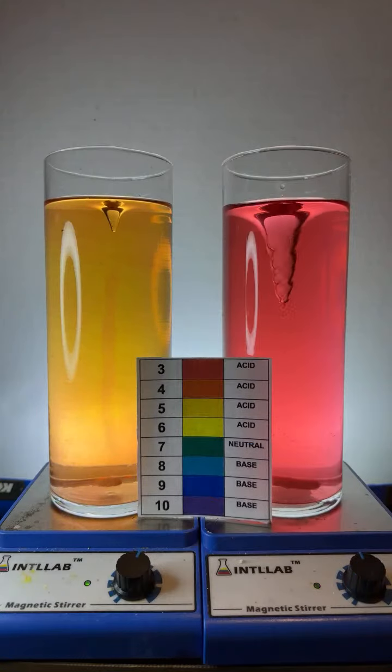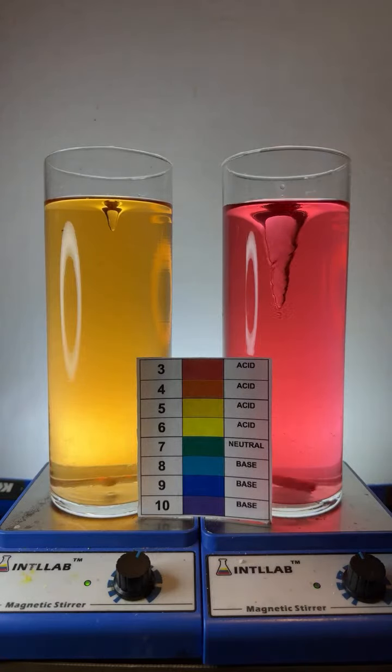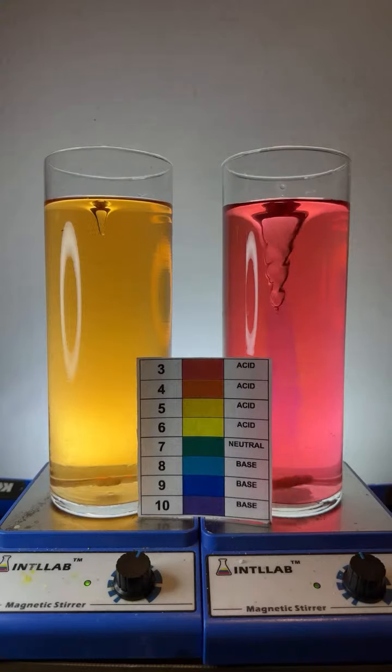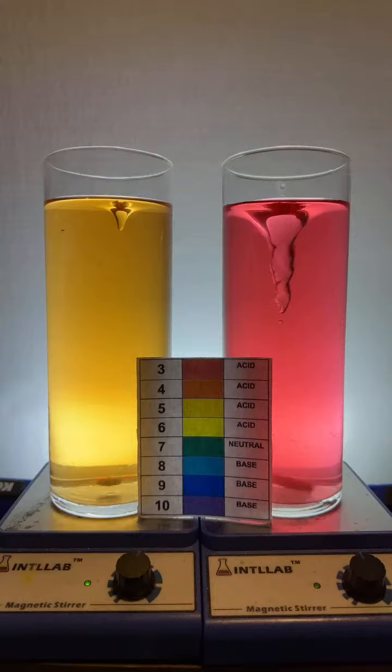And then we'll try adding some base to both. What do we get to? About pH 5 over there on the left. Here we go. Let's start adding some base over here. A couple drops. No, that's not base. I was like, why isn't it turning different colors? Because I was adding acid. Here we go. Let's add a bit of base over here on the left-hand side. You see that flash of blue? That flash of blue tells you that I've added some base. But the blue color disappeared because there's enough acid in here to consume the base that I've been adding.